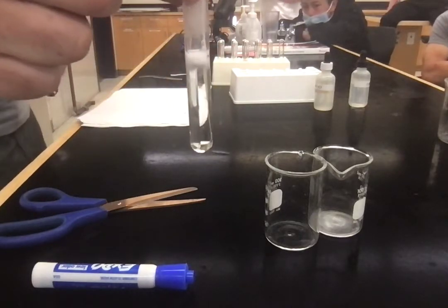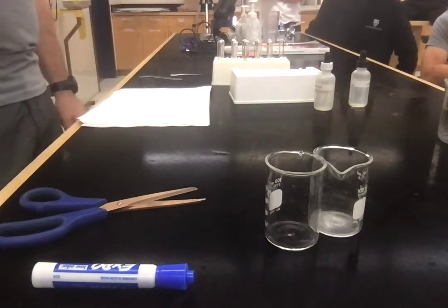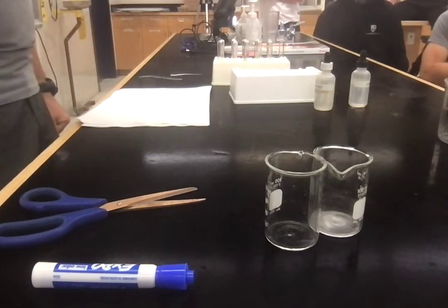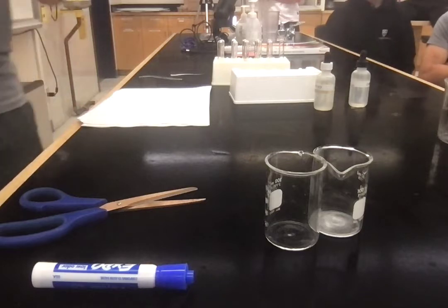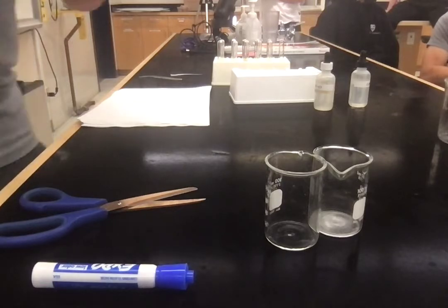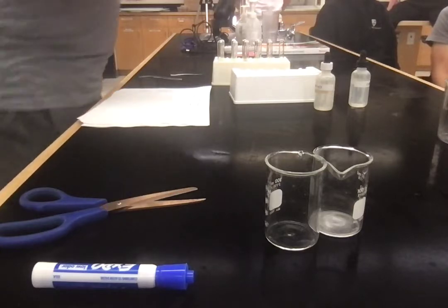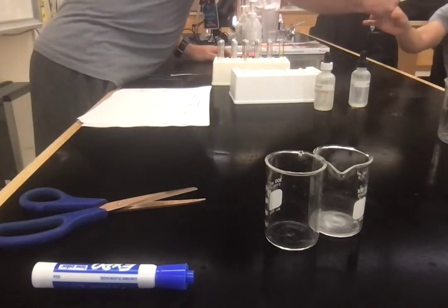Okay. That's bubbly. What do you see, first of all? Something coming off the top. That's probably the reaction. Right. I know you see a reaction. What do you see? Describe. Bubbling. Bubbling? Could you hear anything? Yeah, it's fizzing. Does it smell like anything? Is it warm? It's a bit warm, yeah. Feel it right at the top, where it's bubbling.